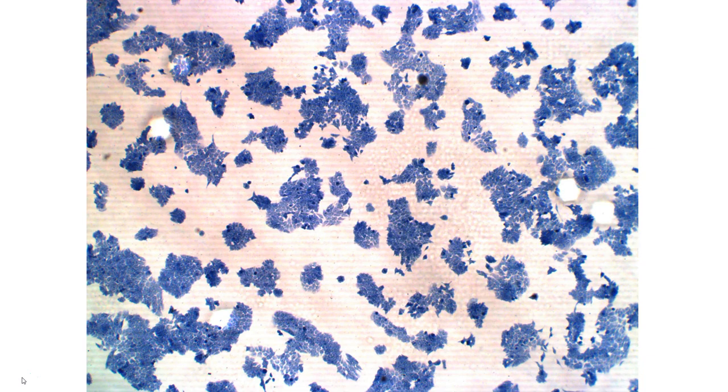When we are looking at confluency of our culture, we are basically looking at what percentage of the surface area of the vessel where you're growing your cells is covered in cells. And for this, we are focusing on cells that are actually adhered to the cell culture dish or the vessel that you're using to culture them in.